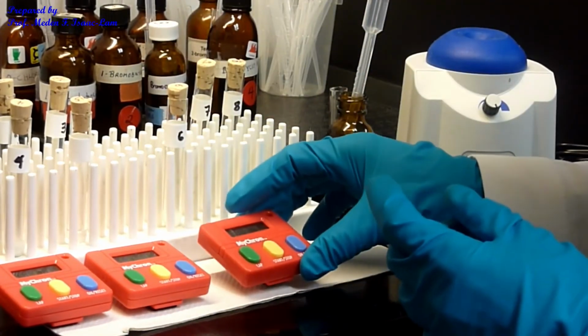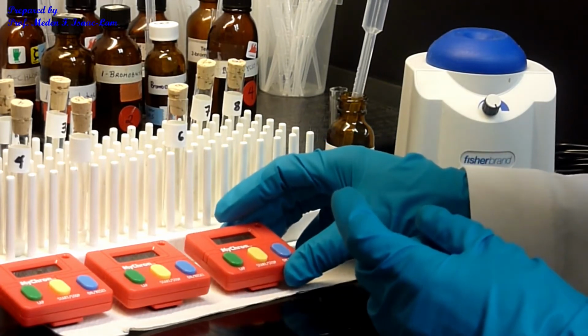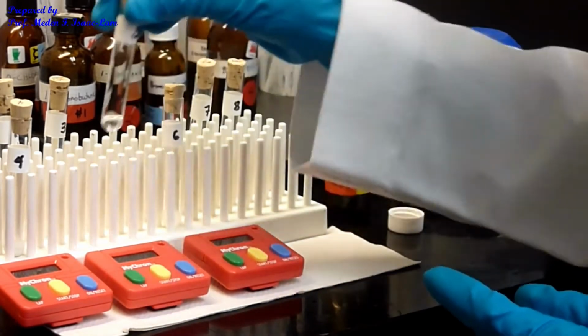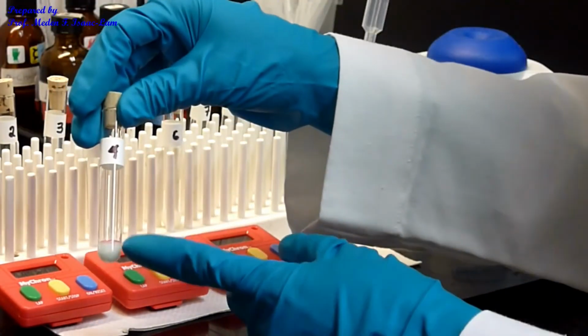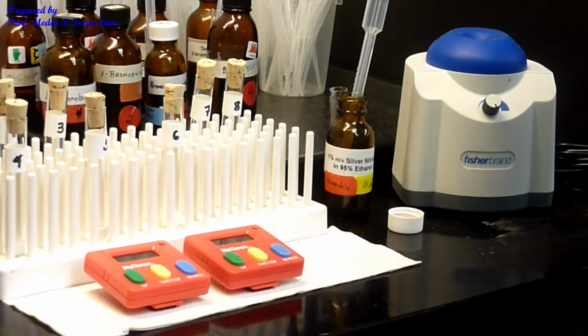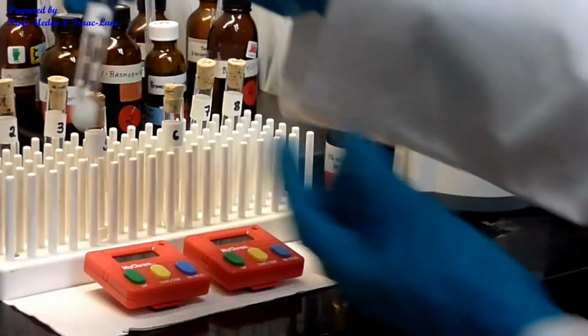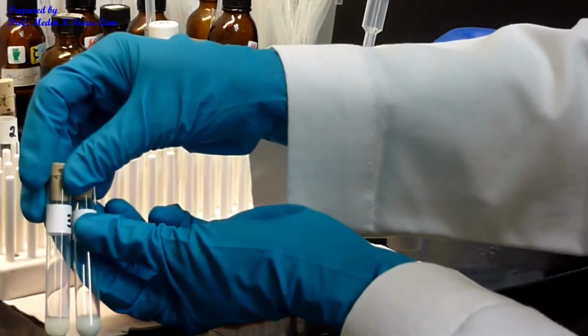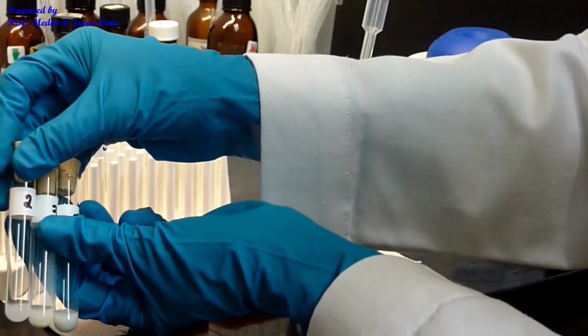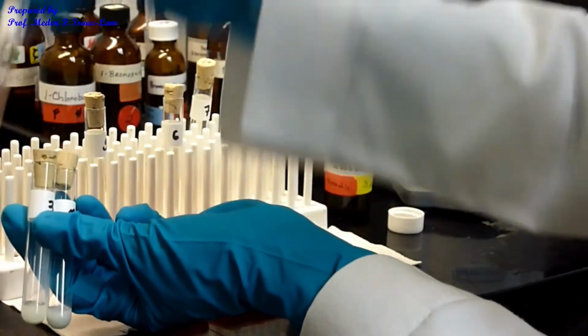So I saw it in less than like 27 seconds or so. So this one, number 5, nothing. And number 4, still the same. Okay? So done for this one. So we compare 2. So 3 is the most, followed by 4, 2, and 1 the least.